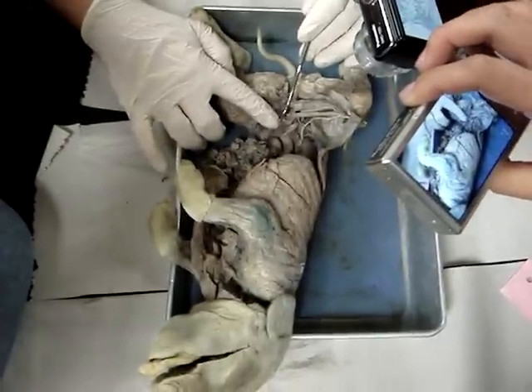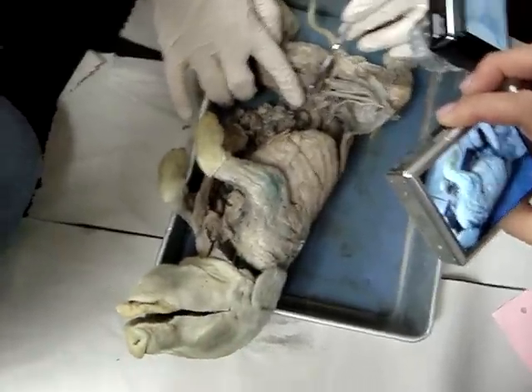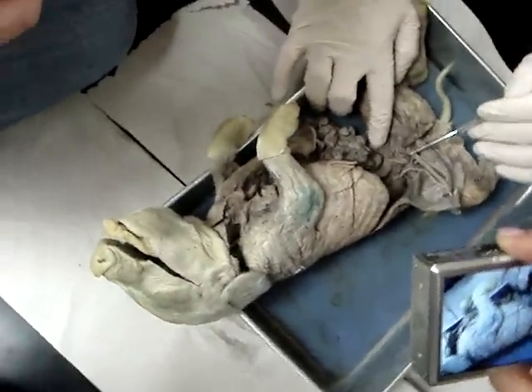It's not well developed — it is a fetal pig, after all. Once she goes through adolescence, that'll become a lot more developed.